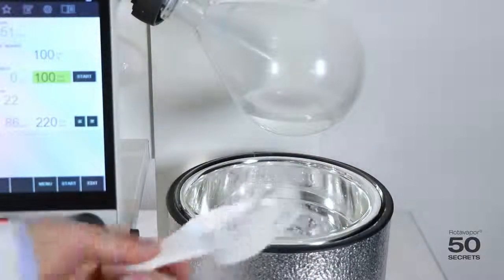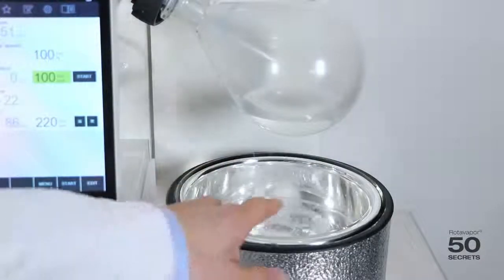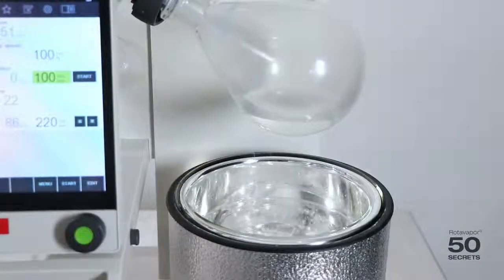Second, we add dry ice, and we wait until the bubbles, which will come up now, calm down a little.